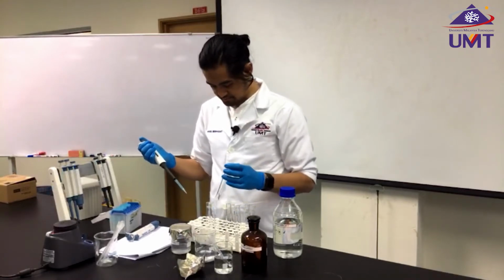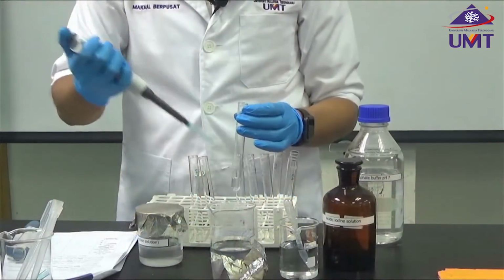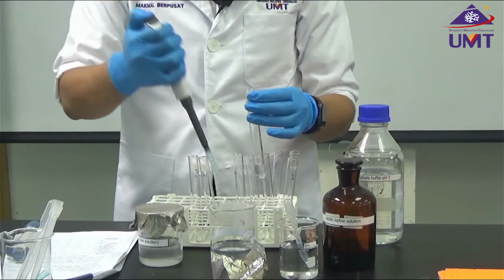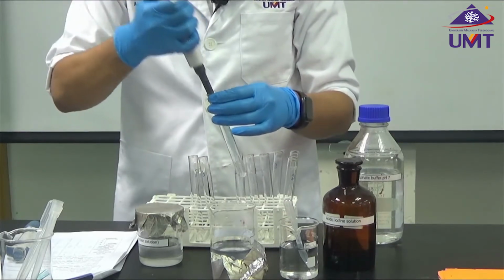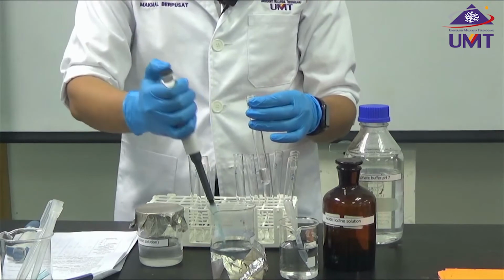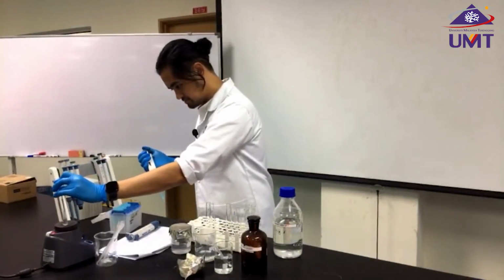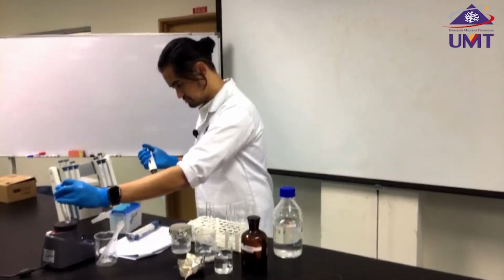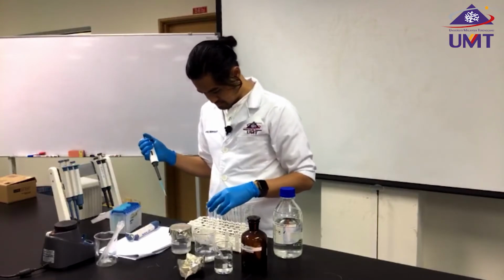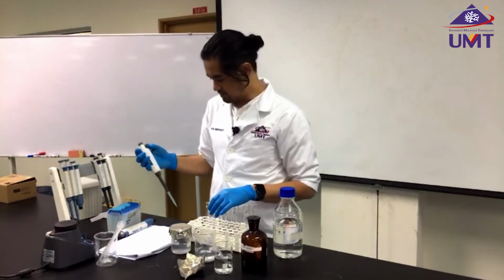I'm going to add 4 times 200, which is 800 microliters of starch. And the last one, I'm going to add 1 ml of my starch.